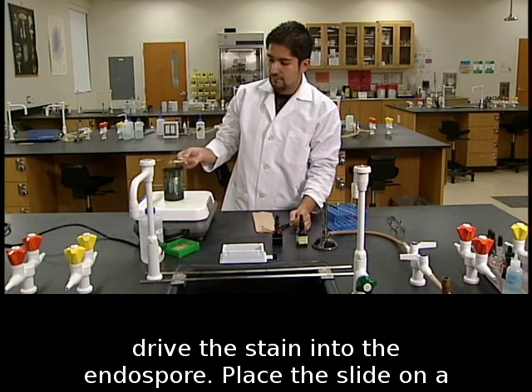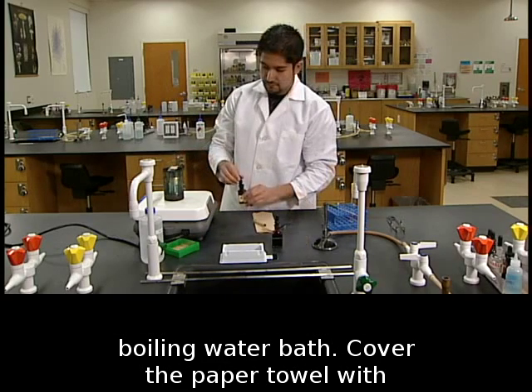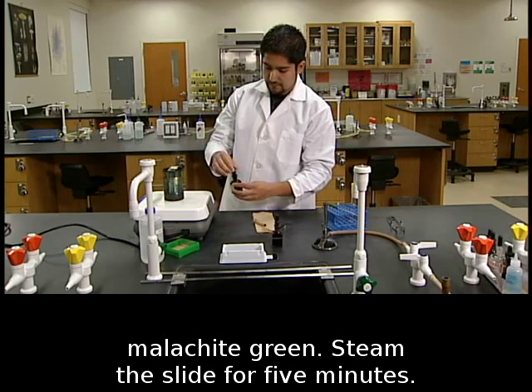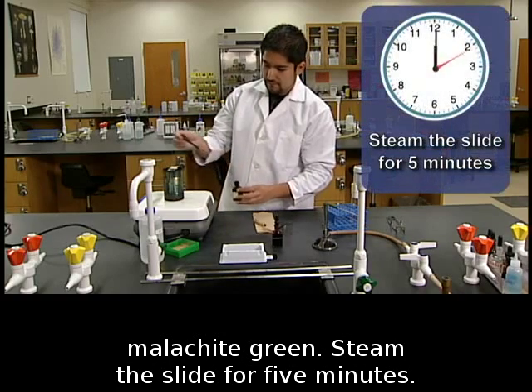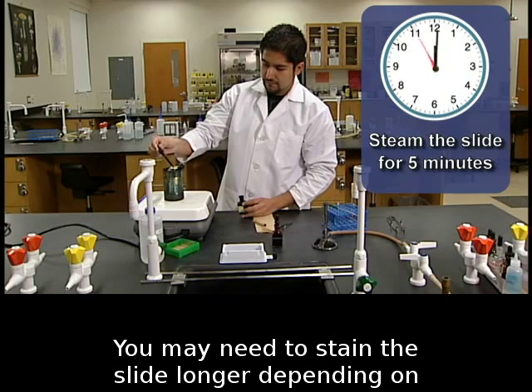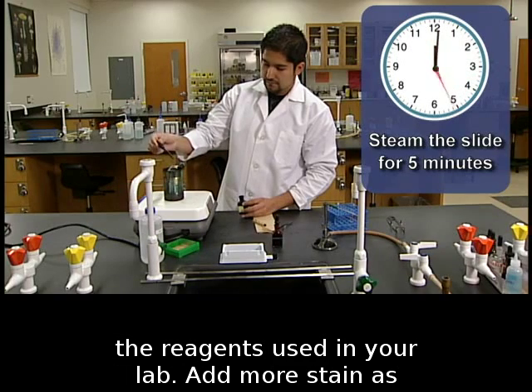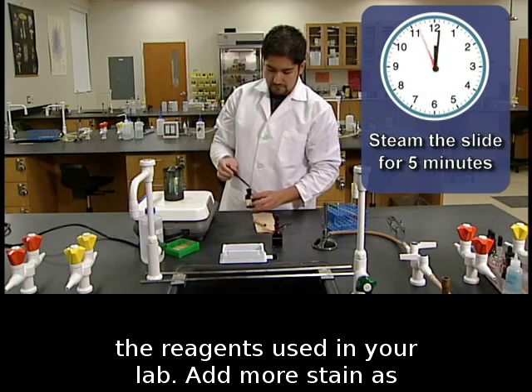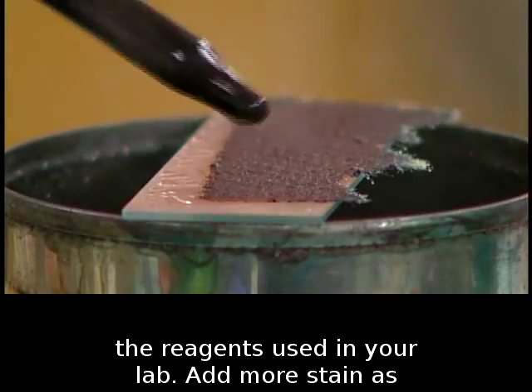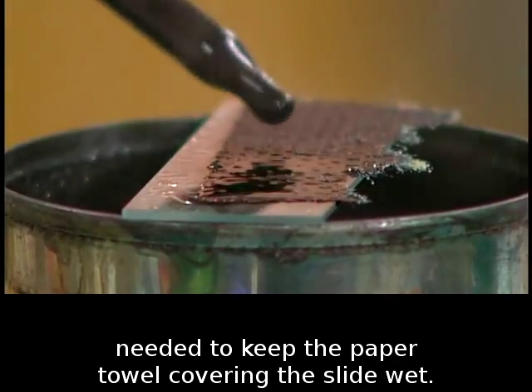Place the slide on a boiling water bath. Cover the paper towel with malachite green. Steam the slide for 5 minutes. You may need to stain the slide longer depending on the reagents used in your lab. Add more stain as needed to keep the paper towel covering the slide wet.